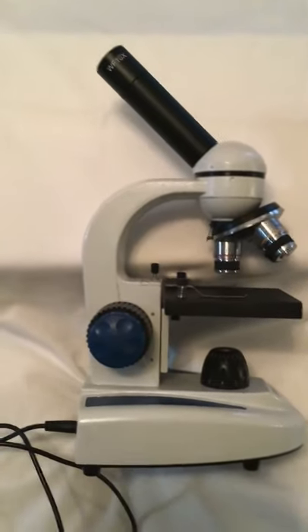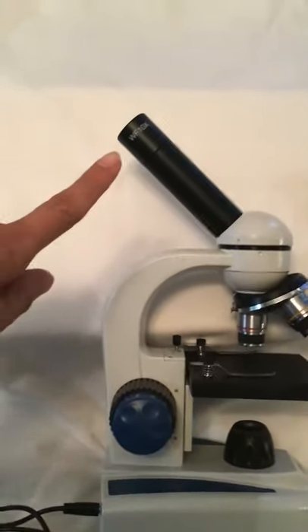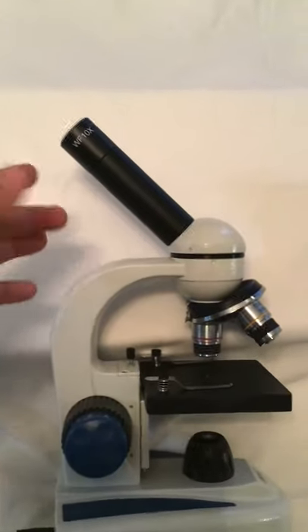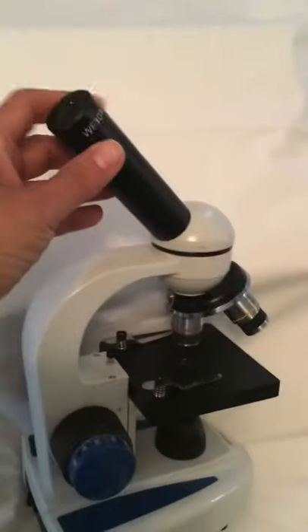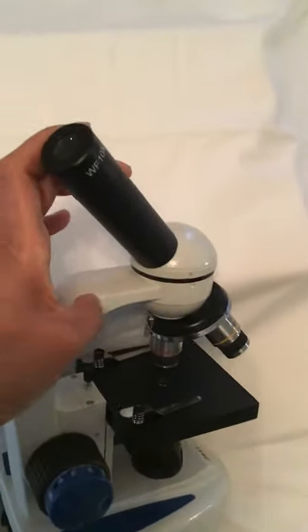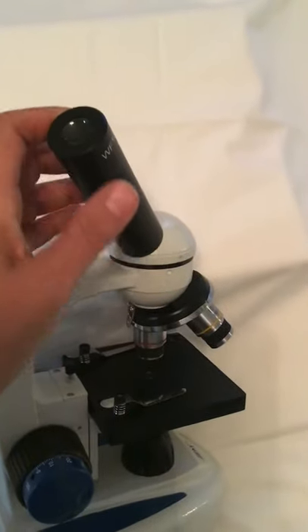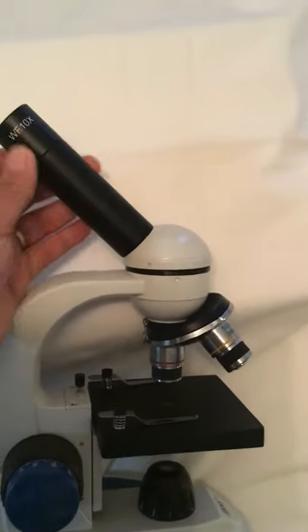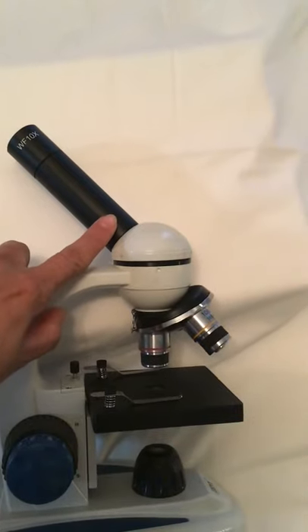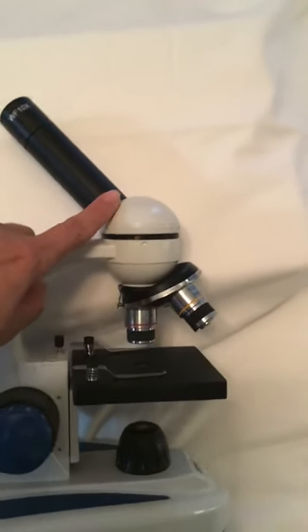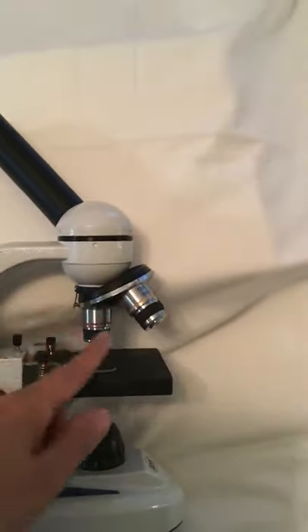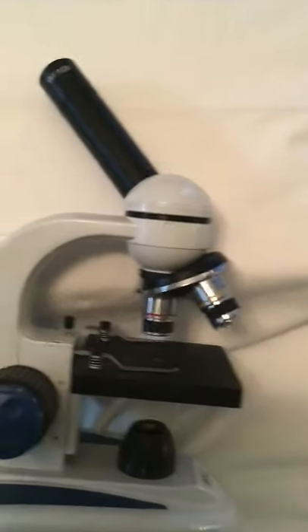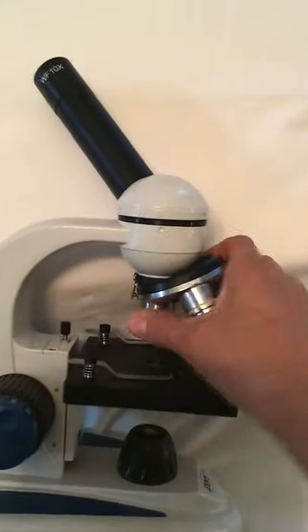I'm going to point to the different parts. This right here is the eyepiece. You would place your eye right up to this lens in order to view the slide. This long black tube is called the body tube. Then it leads down to this section, which is the rotating nose piece. We call it that because it sticks out like a nose and it rotates the lenses.